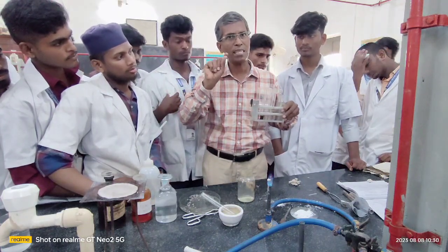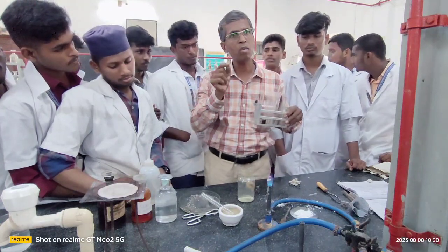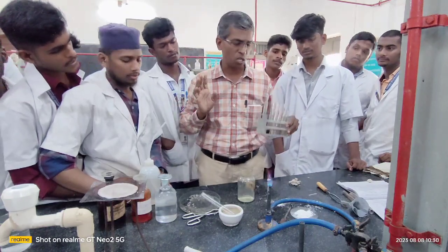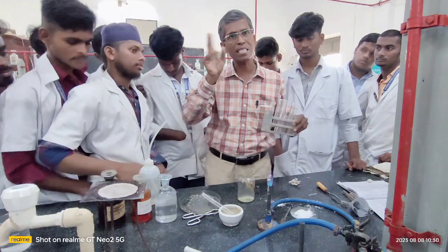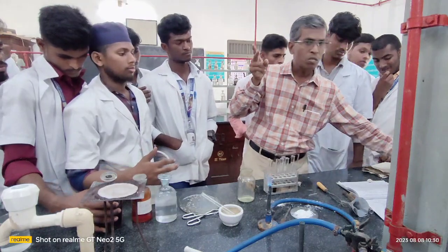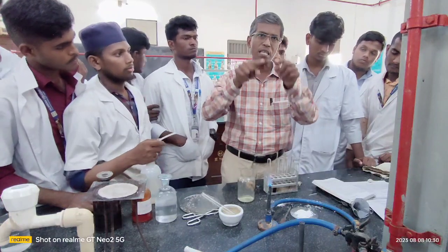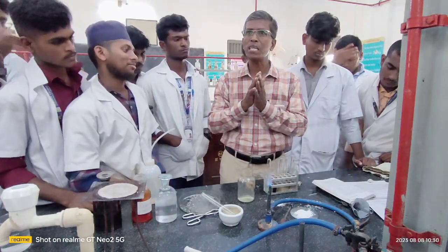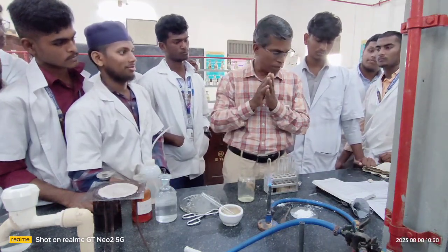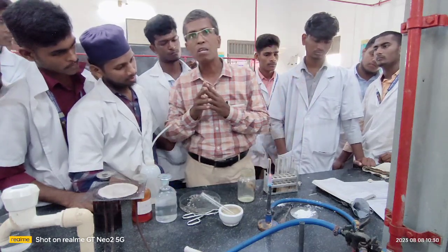Remember, the formation of either blue color or green color after addition of sulfuric acid is purely because of the formation of a complex, an iron complex. Ferric and ferrous react with the cyanide. Sodium metal reacts with the carbon of your compound. Then the nitrogen present in the organic compound will be converted into sodium cyanide in the first step. The sodium cyanide then reacts with the ferrous sulfate and is converted into the corresponding complex. The complex is called sodium ferrocyanide.